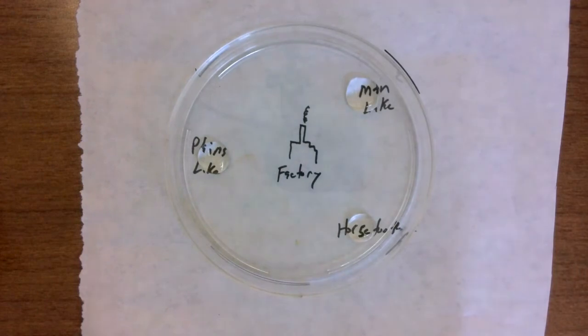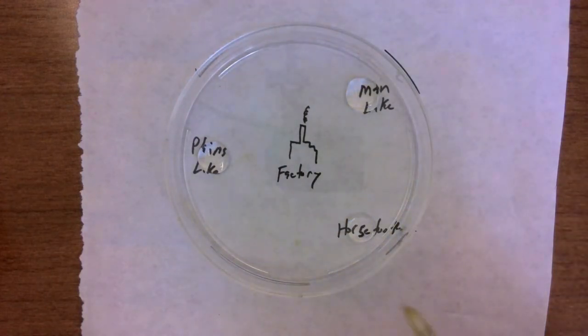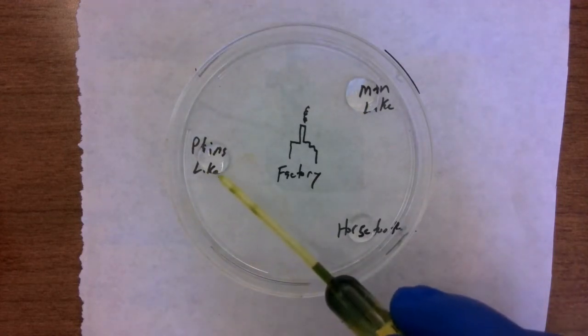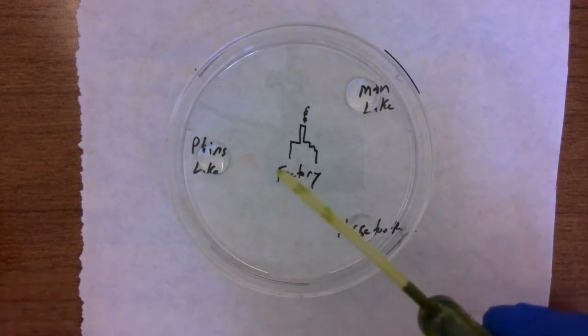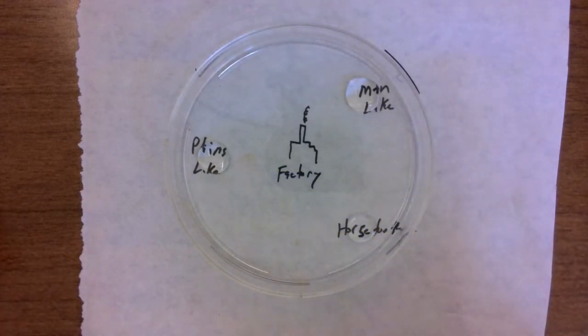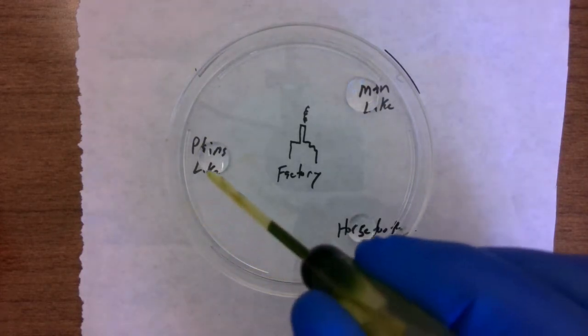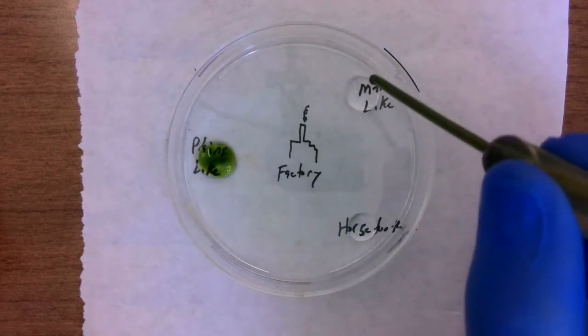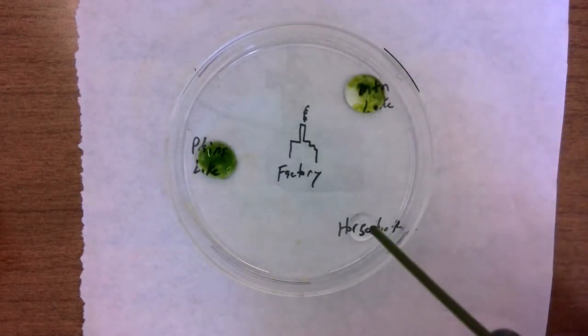Okay. So one thing to note, just as a reminder that you should have read about in the background information, plains lakes often have a limestone base because of the geology of the region that we live in here, whereas a mountain lake is more likely to have bedrock that is made of igneous type rocks like granite or metamorphic gneiss. And that's going to have a major impact, we're going to see in a second, on how things work here. Okay, I'm going to add 2 drops of universal indicator to each lake. Okay. We're going to notice that they're neutral.